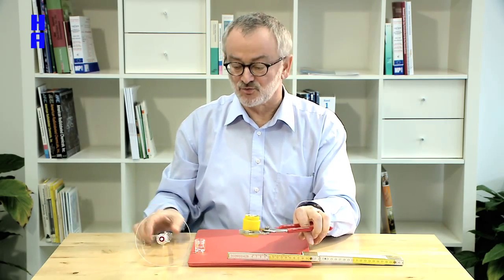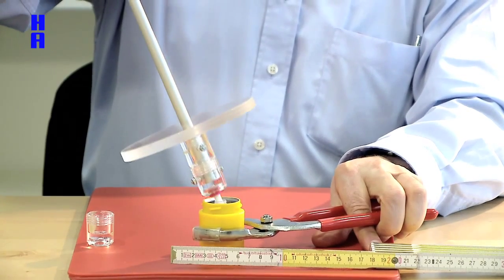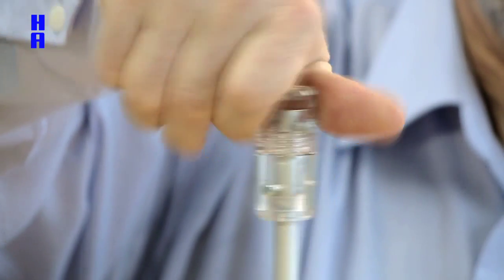After you've finished your work, you return the Eppendorf tube, screw back, bend away and everything is done. It's as easy as that.